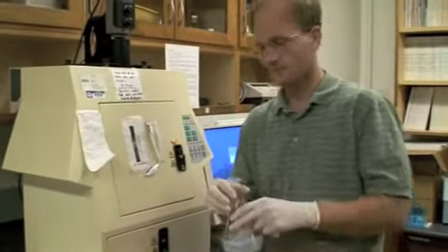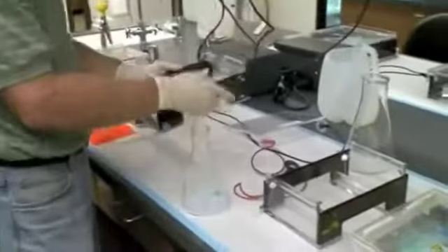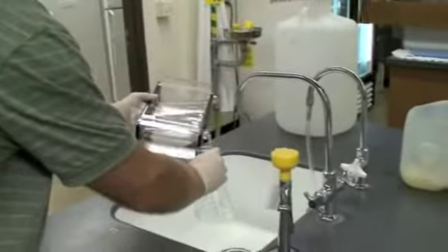Now we've got the gel. I'm going to add a little bit of, just a tad of gel buffer. We lost some during boiling. A tad, I mean, just a few drops is all.